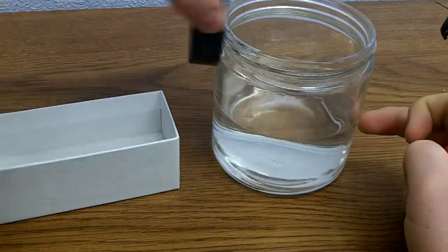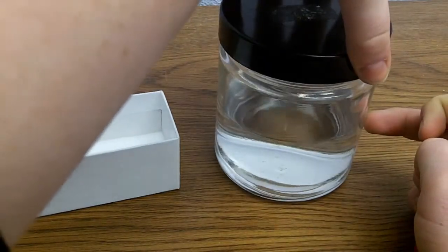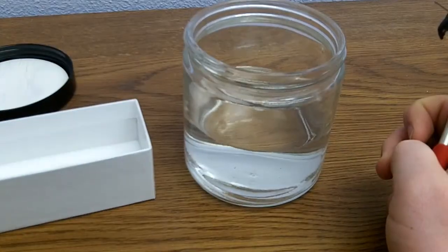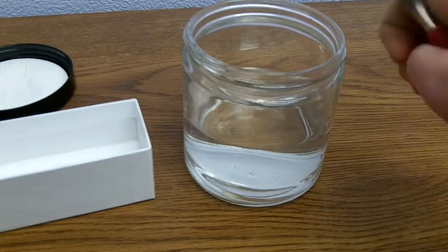I have a capped jar of ethanol, and I keep it capped so it doesn't evaporate and I can reuse it.